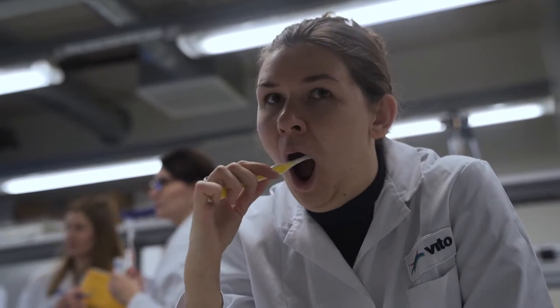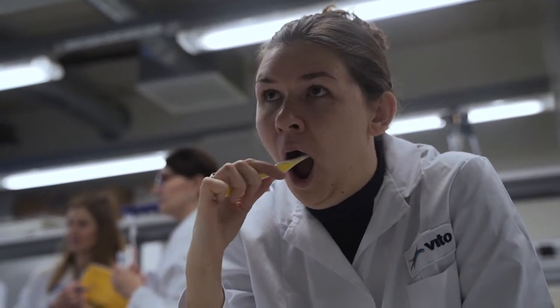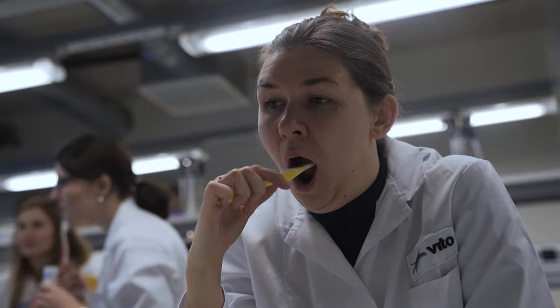Take one toothbrush and make 10 circles on the buccal swab surface, which is inside the cheek wall, and then the same on the other side of the mouth. You can use that toothbrush with sample for buccal micronucleus assays.